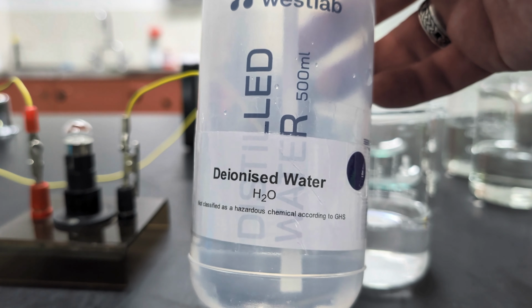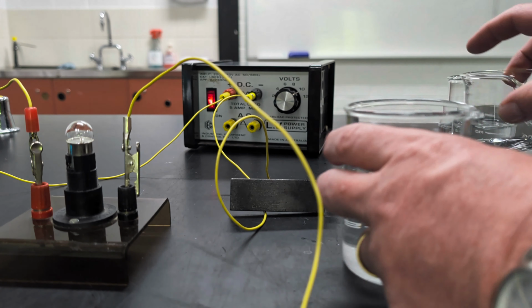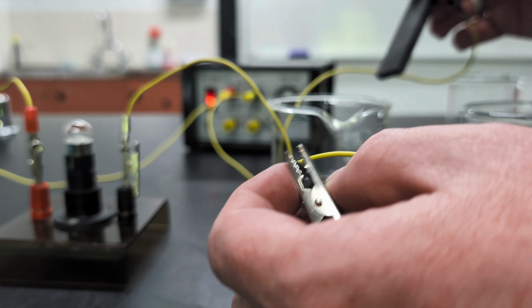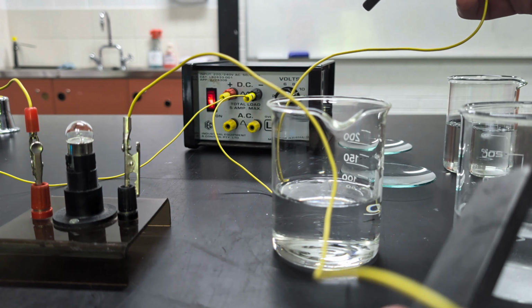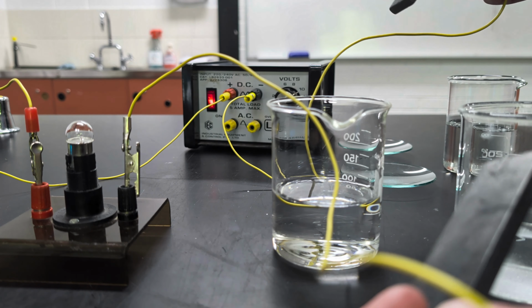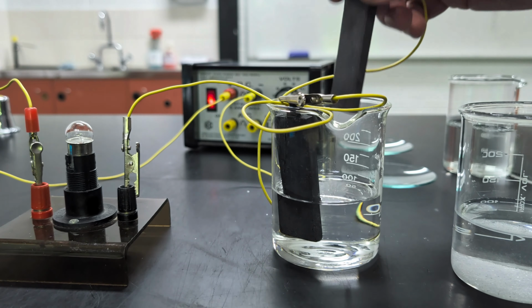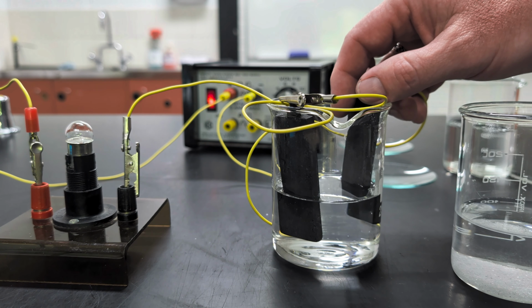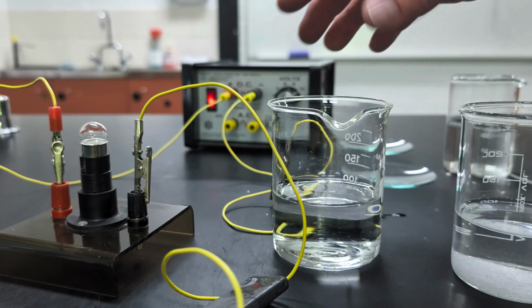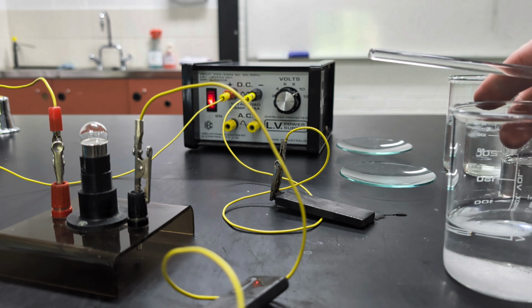There you go. I'll show the camera officially. Deionized water, not straight from the tap, but made in the science lab. Actually, let's just test another beaker. Let's just show that water is actually a very poor conductor of electricity. If the current is high enough, it can conduct a little bit because water self-ionizes, it self-dissociates, but only 1 in every 10 million water molecules, so it doesn't conduct very well. So one electrode in, other electrode in, and you'll note the lamp isn't glowing. So any glow that we see is not because the water conducted current. As I said, water is a very poor conductor of electricity.